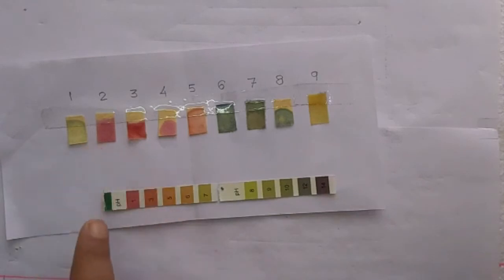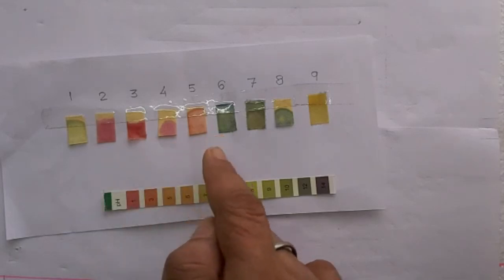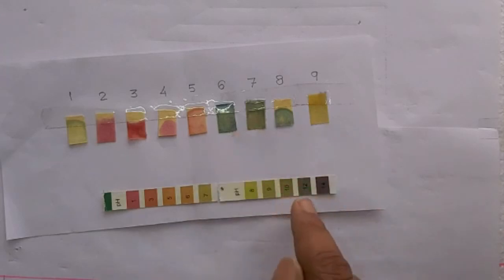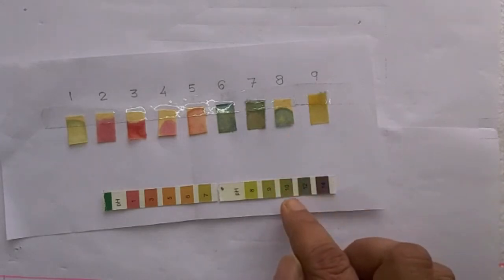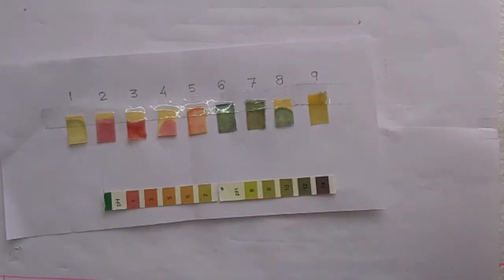And this is an acid close to 1, and this is 3, about 3, 5 and 6, and then this is close to 12 and 10. This is also close to 10, and this I think is close to 8, maybe 7.